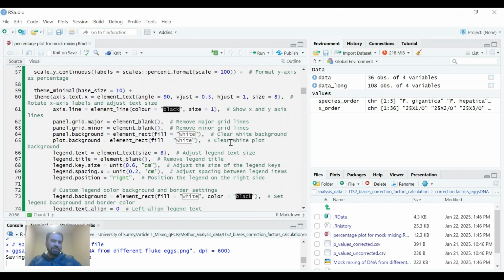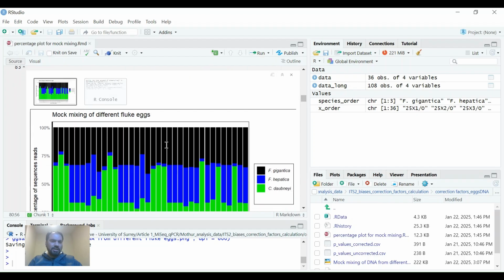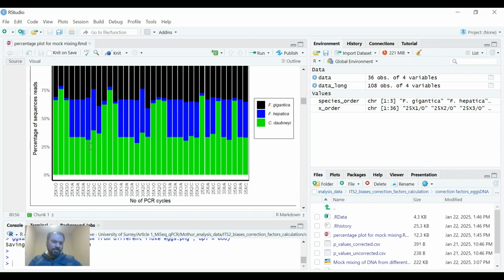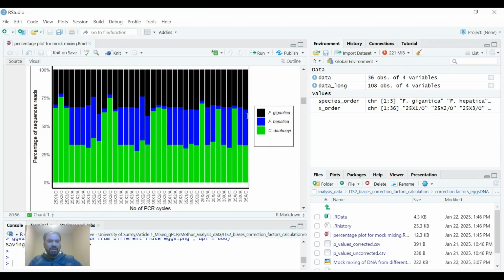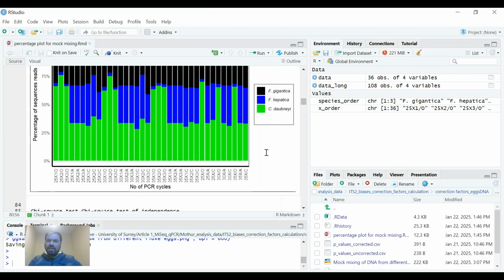Now you can see here that it is producing a chart for us, and here you can see a clear bar chart with different percentages of mixes inside. Here you can see that on the x-axis is the number of PCR cycles as we have defined in the above section, and on the y-axis the percentage of sequence reads, and these are different color combinations that we have defined in the script, and this is how it looks. A beautiful chart is produced, and I hope you found this tutorial easy and in simple words.